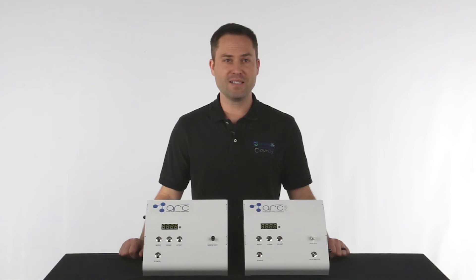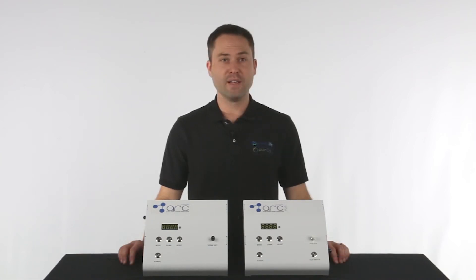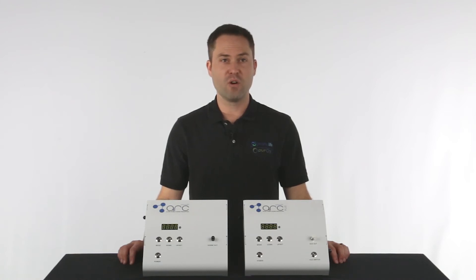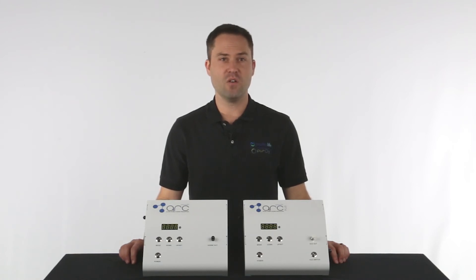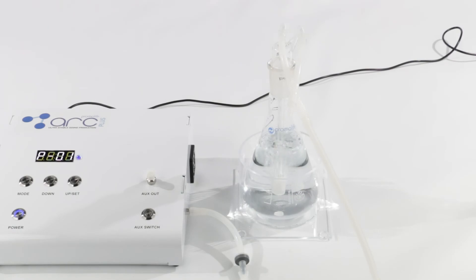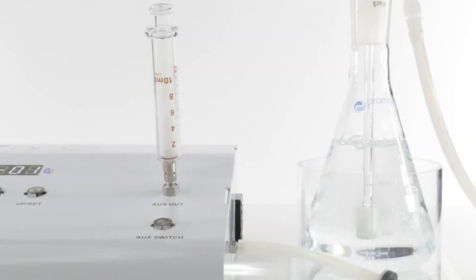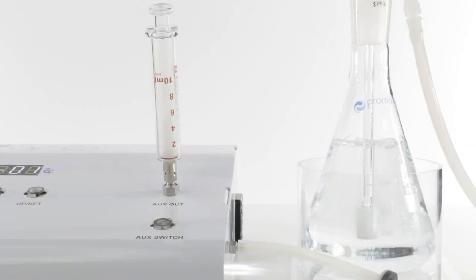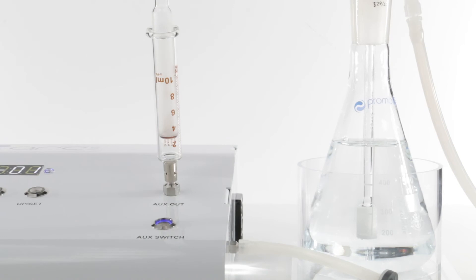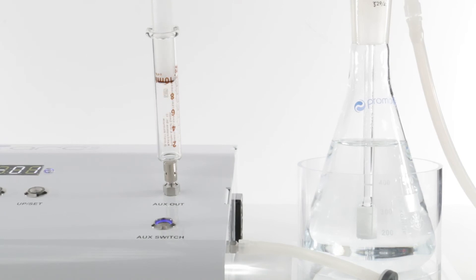That covers the basic operation of this ozone generator. Now let's move on to the auxiliary port of the PLUS model. The auxiliary port changes the flow direction of the ozone. Currently the ozone is exiting from the side port into the bubbler. By pressing the auxiliary power button, the flow will now exit through the auxiliary out port on top of the ozone generator. As you can see, the water has stopped bubbling and the syringe is beginning to fill.